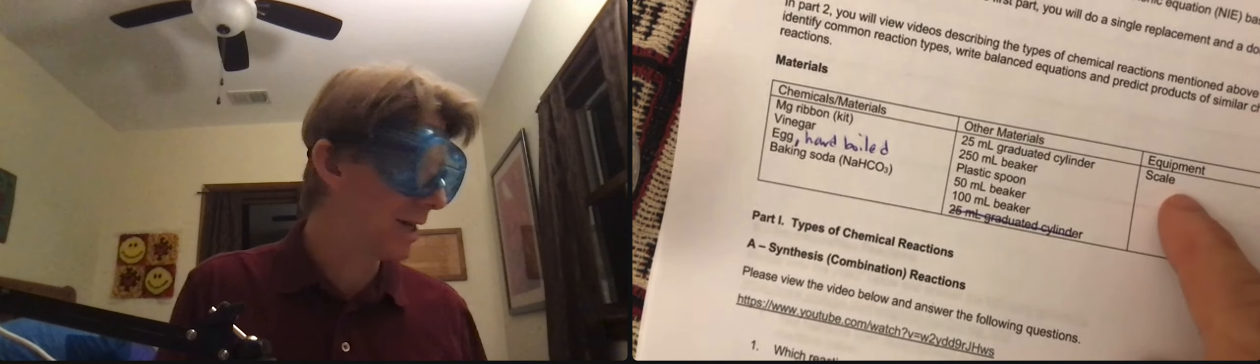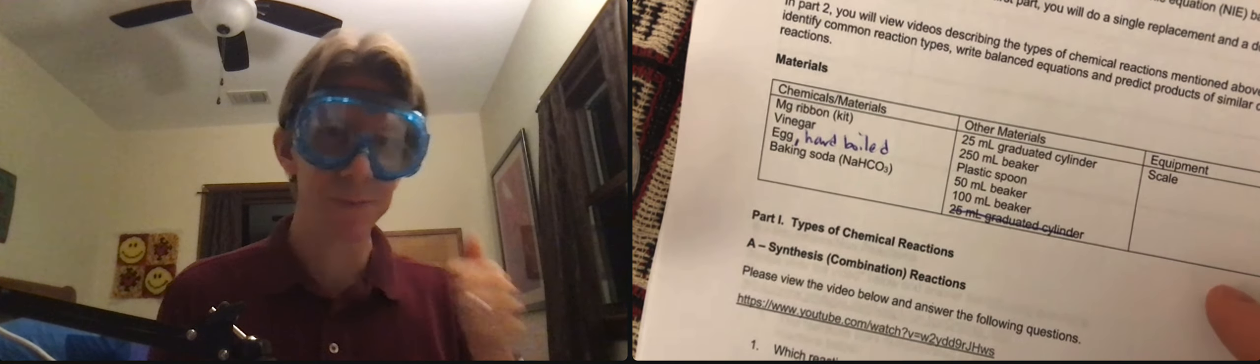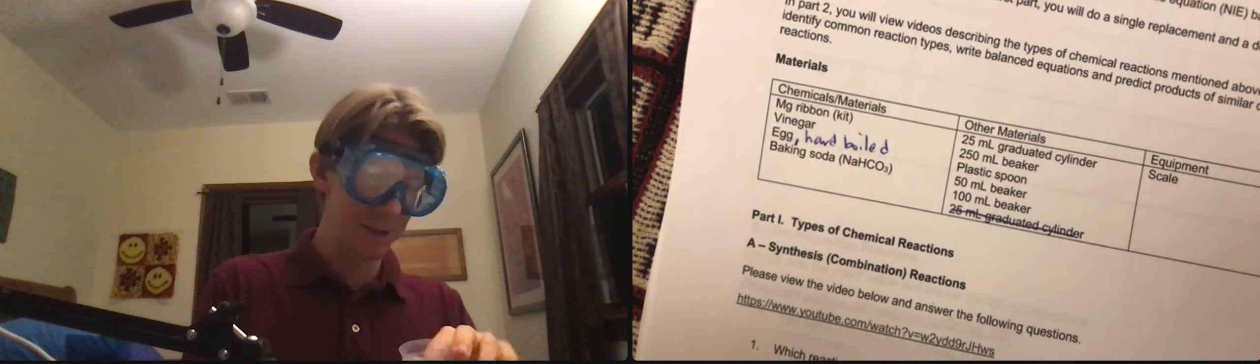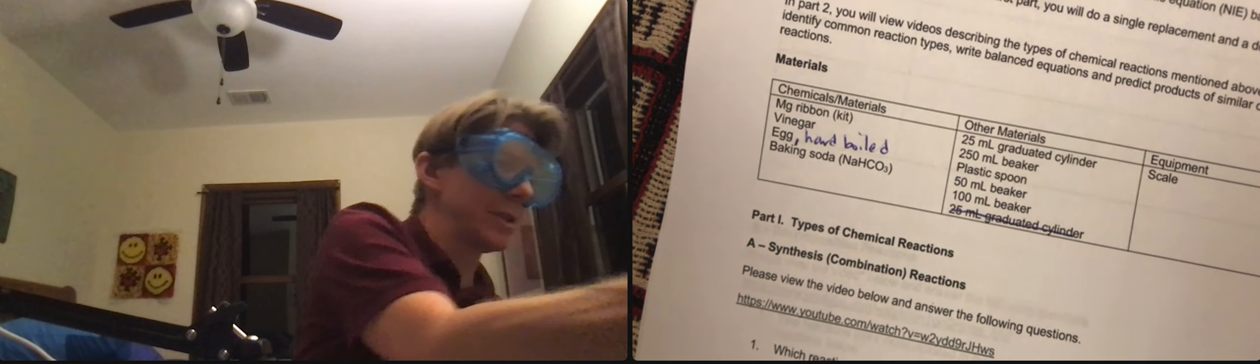And the scale. I've already shown our scale. I just recharged it a little bit, so hopefully it'll keep all the way through this experiment. Everything's clean and dry because I just cleaned it. Except for maybe that thing. Well, we'll give it a quick rinse.